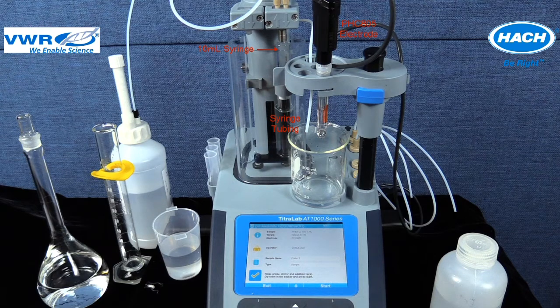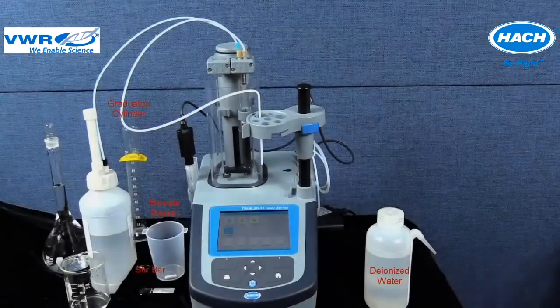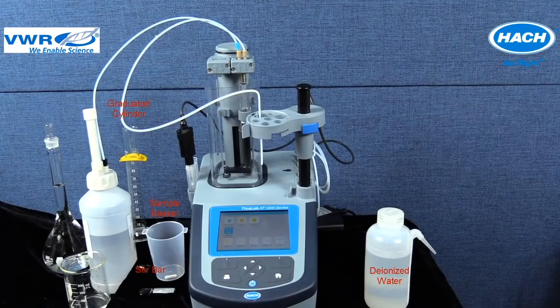The pH electrode model PHC805 has been connected to the titrator in the back of the instrument in sensor port 2 and placed in the sensor holder using the electrode sleeve received in the application pack. The following items have been prepared for use, including a clean glass graduated cylinder, sample beakers and stir bars from the application kit, a wash bottle filled with deionized water, a waste container, and a sample to measure.